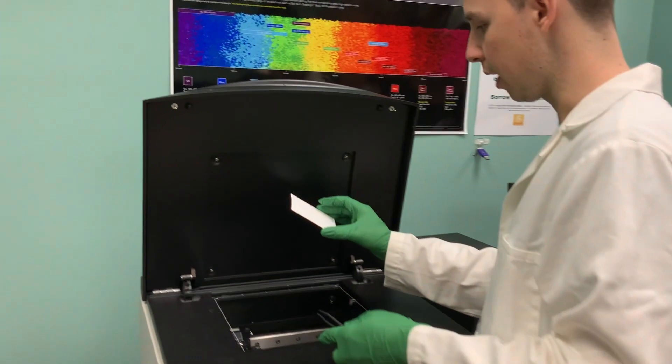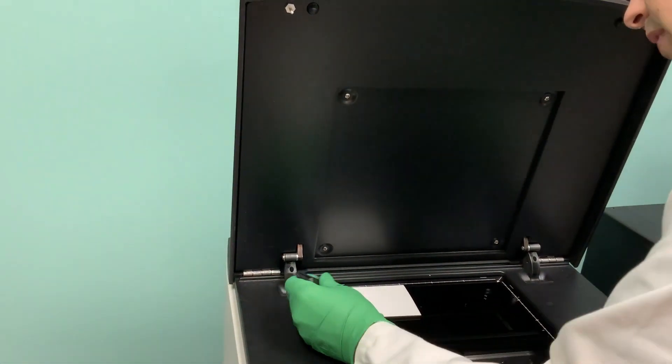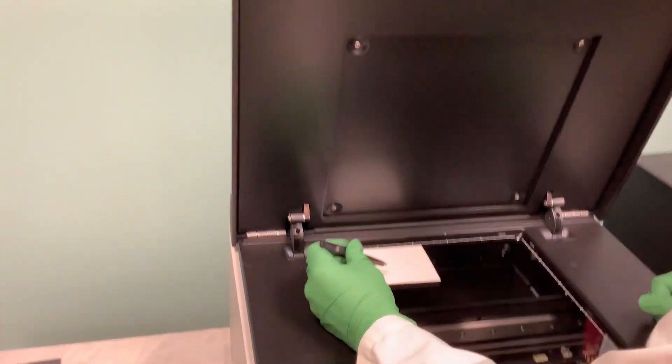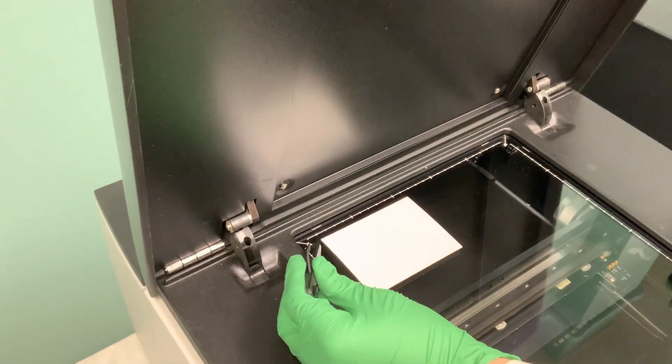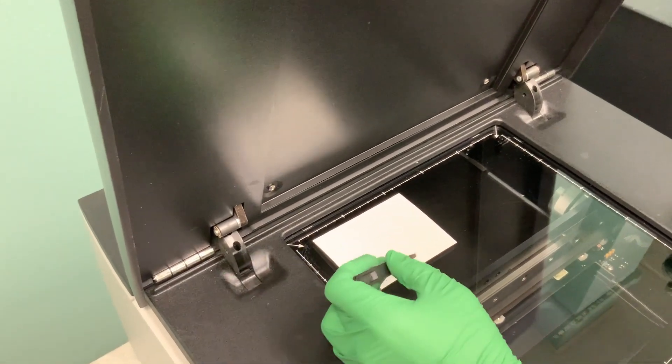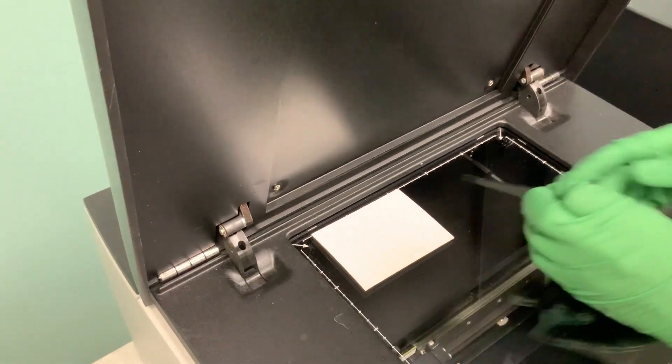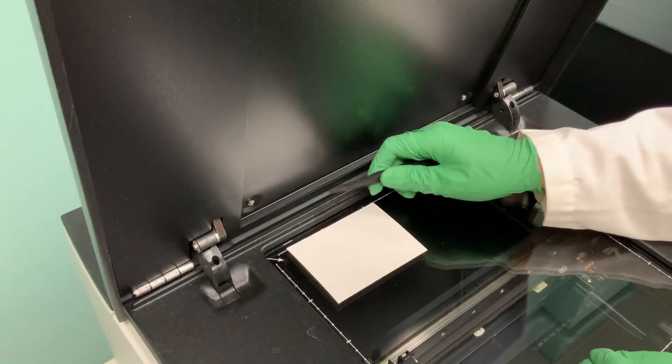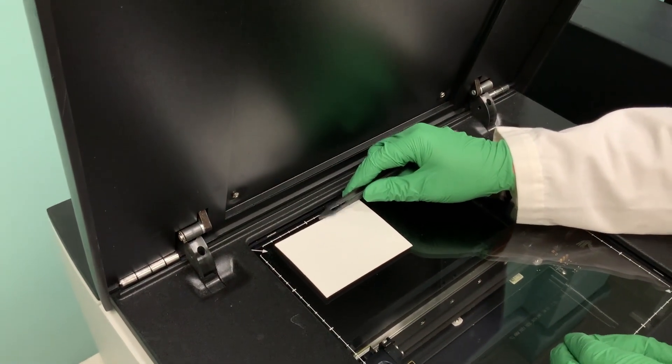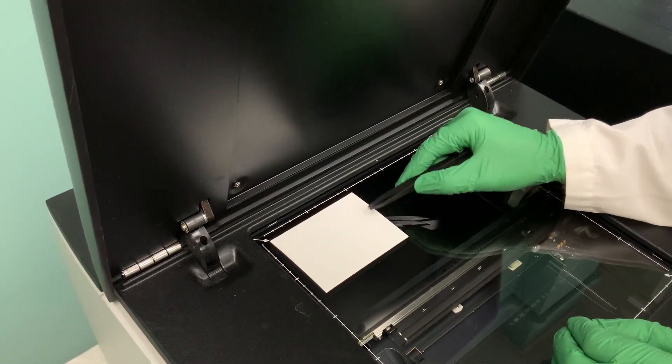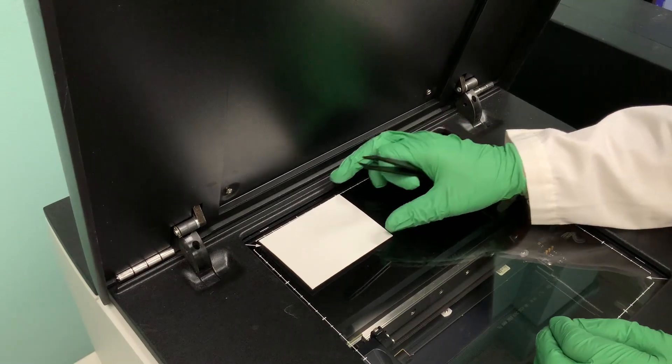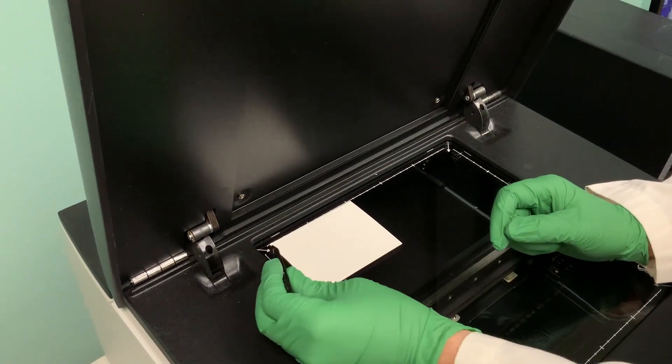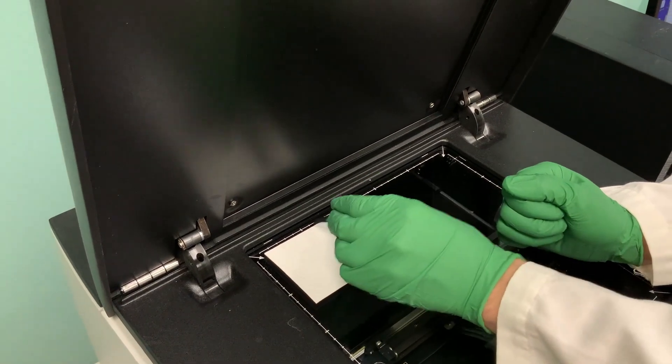We're going to place it in, and what you want to note on this stage is there are grid markings. The top, we can't go all the way up against this line because the first tick is actually here. Same thing on this side, we can't go all the way to the left. We have to make sure it's at least at this corner.